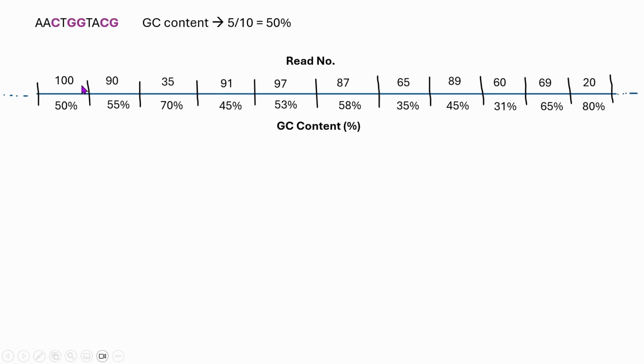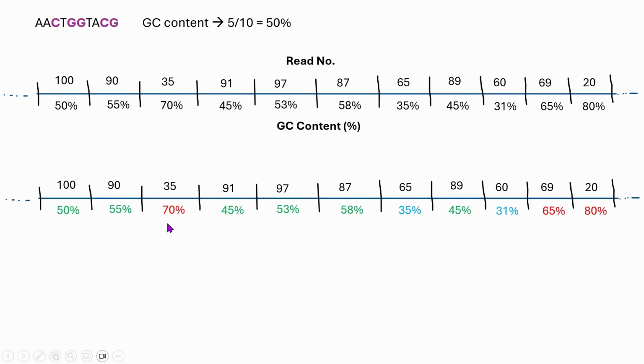Now above you can see the number of reads we get after sequencing from each region. For example, from this region we get 100 reads, but from this region we get only 60 reads. And from this region we get an even lower number of reads, for example 35 right here. Now let's look at this even more carefully. You can see when the GC content is close to 50%, for example these green ones, the number of reads is relatively higher. But when the GC content level is much higher than 50% or much lower than 50%, then the read count reduces quite a lot. So that is something you should hang on to at first, because that is the basis of GC bias.